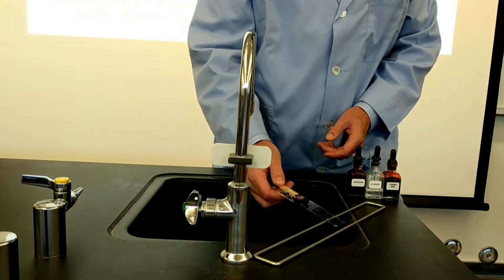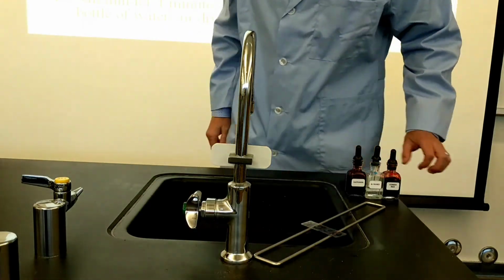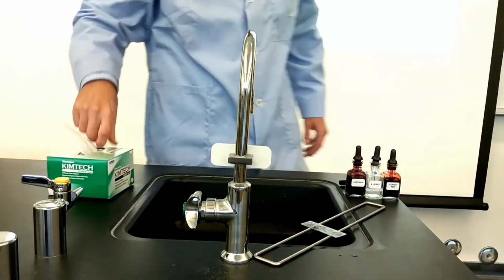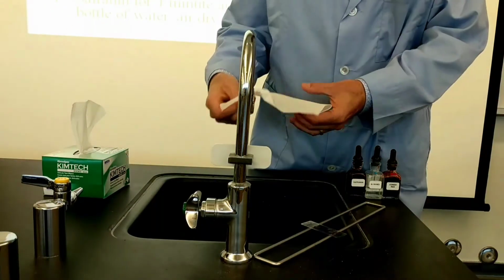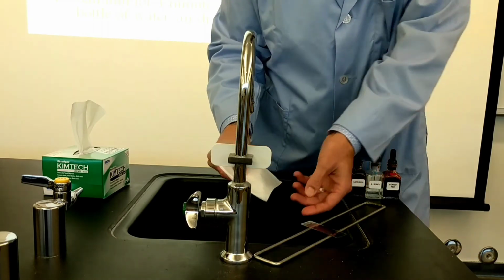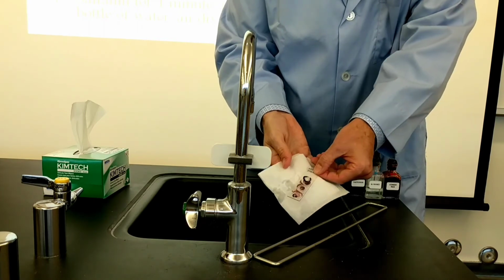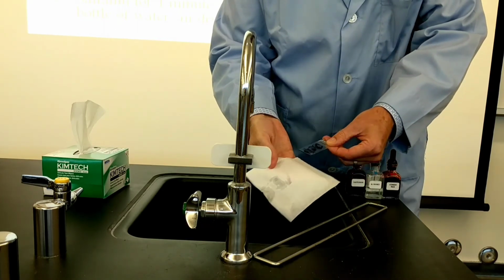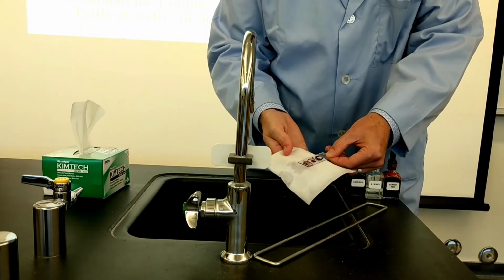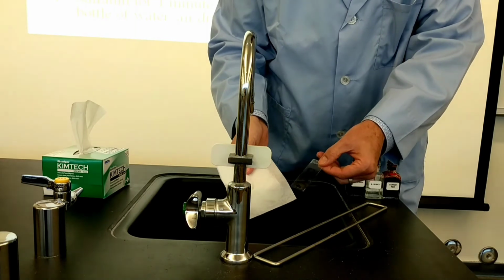And that's it. So now I'll show you the blotting technique. You can use a paper towel or a Kim wipe. I've got a Kim wipe here, which is like a delicate little towelette. And then what I'm going to do is just wipe the bottom. It's okay to wipe the bottom of the slide because the bottom has nothing on it. It's just bare glass. The top you wouldn't want to wipe because then you'll damage the smear.